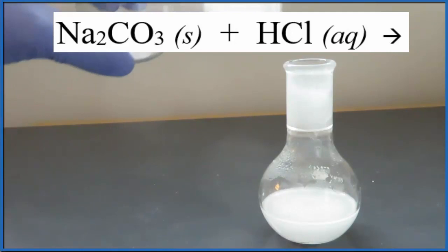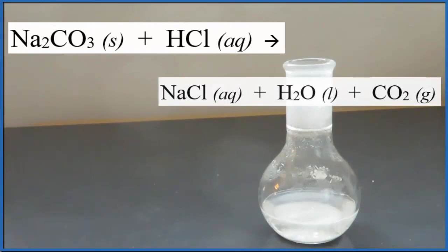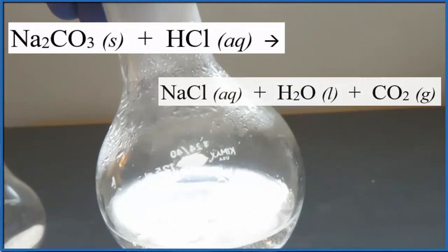So that's the chemical reaction when we have sodium carbonate plus HCl, Na2CO3 plus HCl. The products, we end up with NaCl plus H2O plus CO2. And that CO2, that's the gas, that's what caused the bubbles.